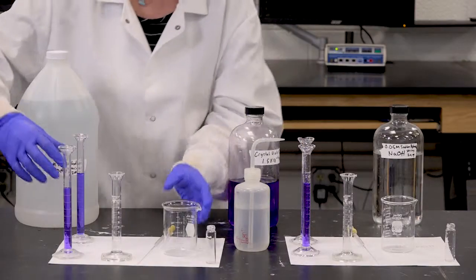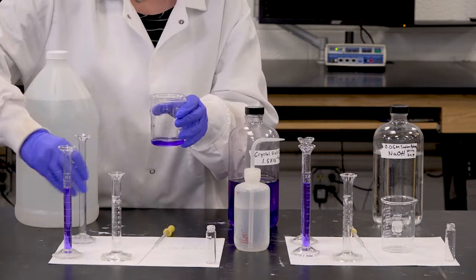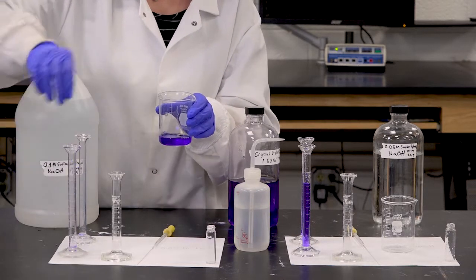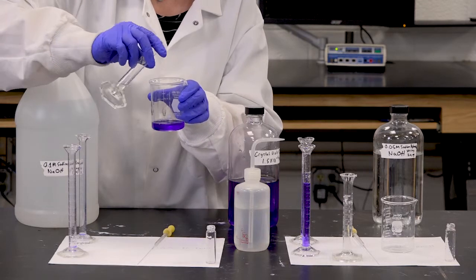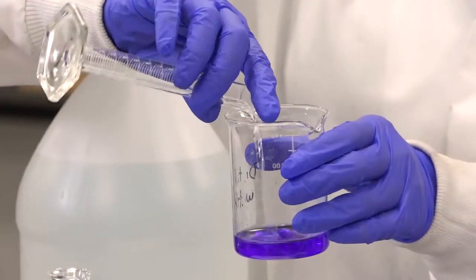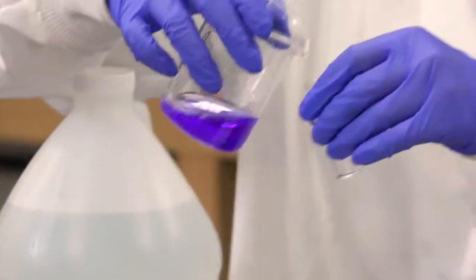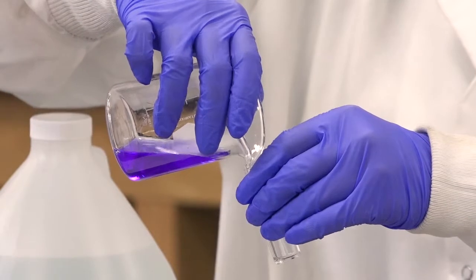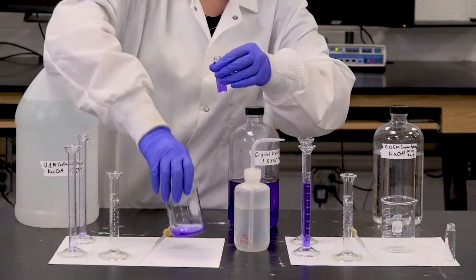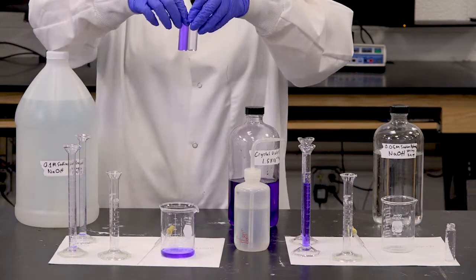So now I'm gonna prepare my solution, where I'm gonna put the crystal violet into the beaker. And I'm gonna follow that with the sodium hydroxide, and I need to make sure that I do this as quickly as possible, because the moment I add the sodium hydroxide, my reaction is beginning. So I'm gonna pour that in there, give it a quick little swirl, and then pour it into the vial that is gonna go straight into the spectrophotometer for absorbance measurements. Now, do pay attention to the color, because at the end of the reaction, we expect it to be clear.